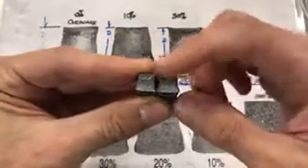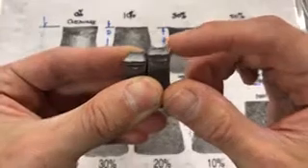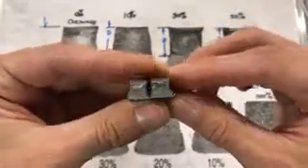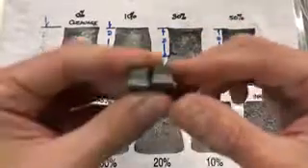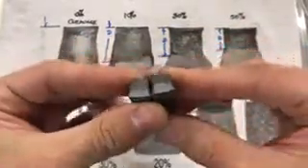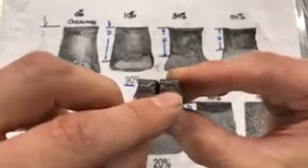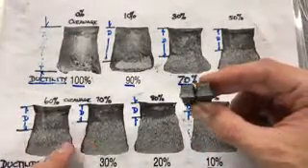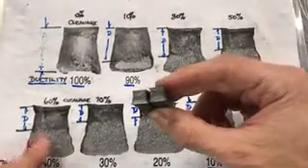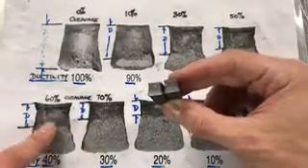So the upper portion, you see this shear lips was fractured mostly in ductile fashion, so it is associated with some plastic deformation, and therefore you can kind of draw the boundary between these two regions and see what situation, what case we shall have here. I believe it is something maybe between this, and I believe it is more of this case.